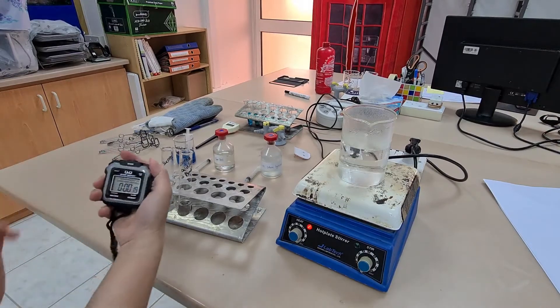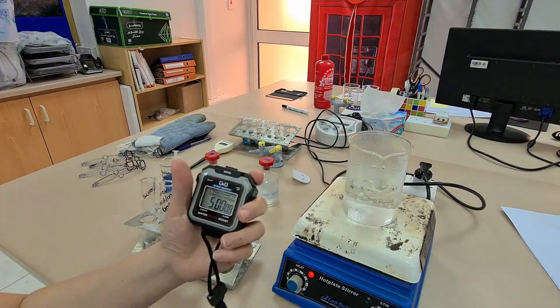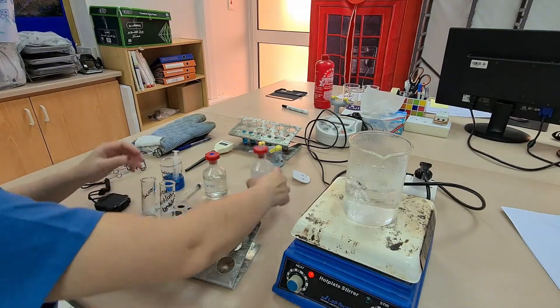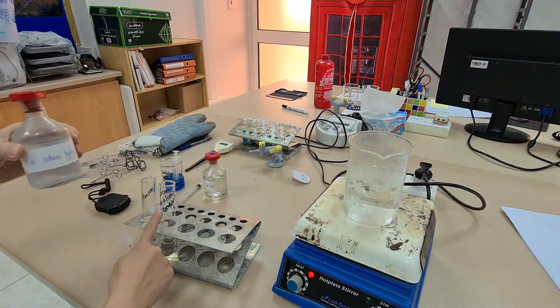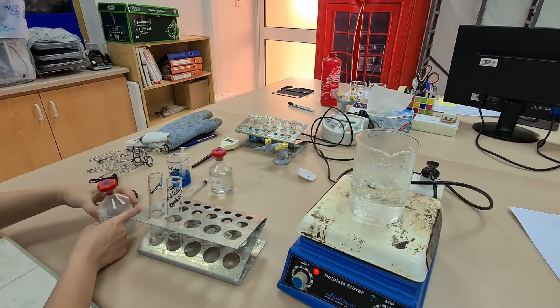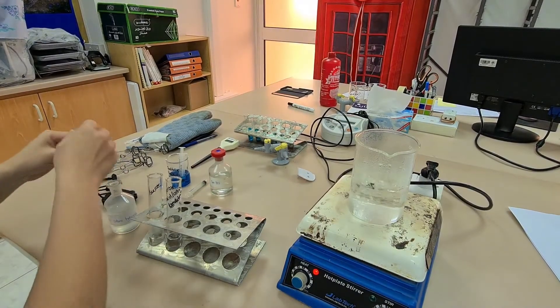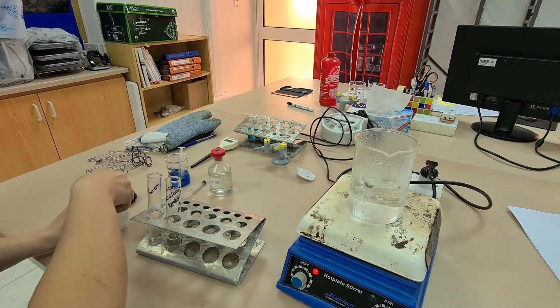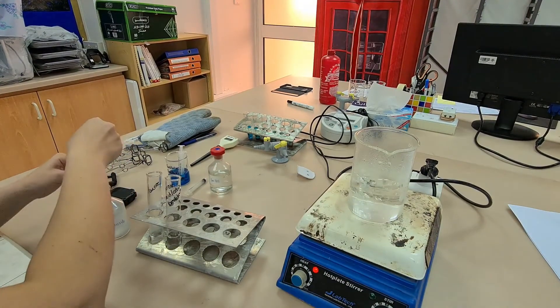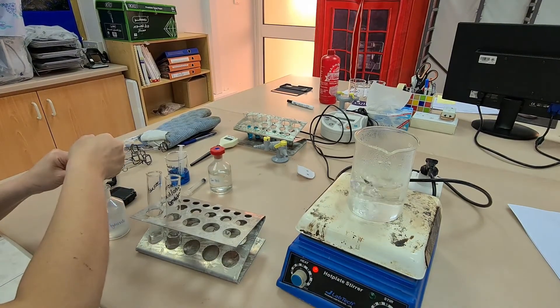After five minutes in a boiling water bath, I can remove my sucrose and hydrochloric acid solution. However, now I need to neutralize it because otherwise, if it was acidic, the acid left in there may actually interact with the Benedict's reagent and that would be adding another variable to my experiment.